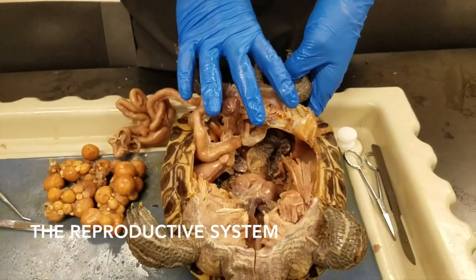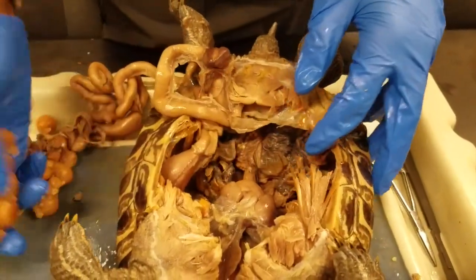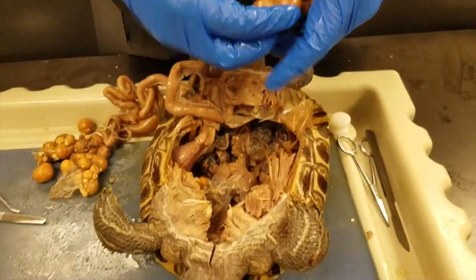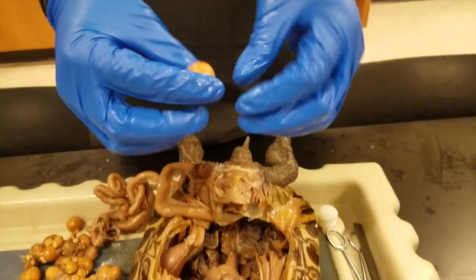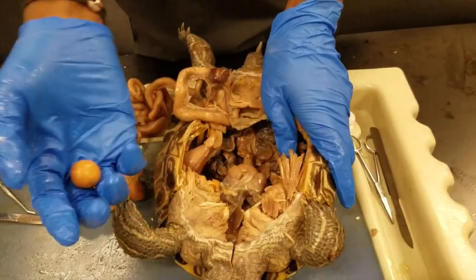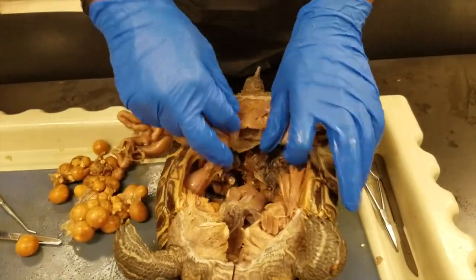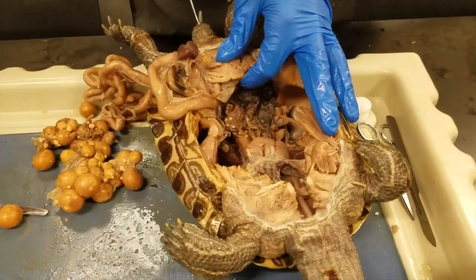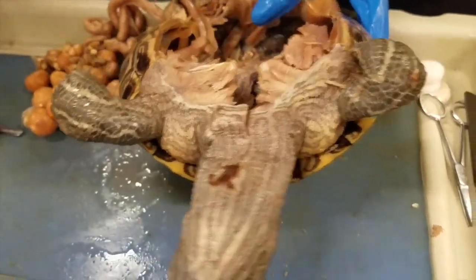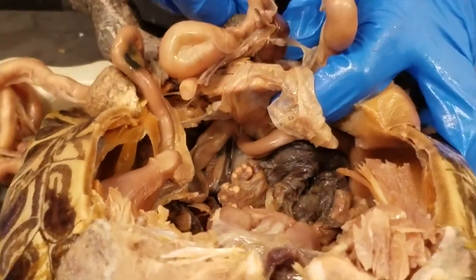Near the posterior end of the turtle, we have these two reproductive structures called the uterus. At the beginning of the dissection, ventral to them, we found the eggs. The turtle is oviparous, meaning it lays eggs. These eggs have a membrane around them to keep the inside from desiccating or drying out — an adaptation that all reptiles have when they came from water onto land. We also have the cloaca, which doubles as an excretory and reproductive structure. It goes from the outside to inside, helping drop off eggs as well as nitrogenous waste and other waste products.